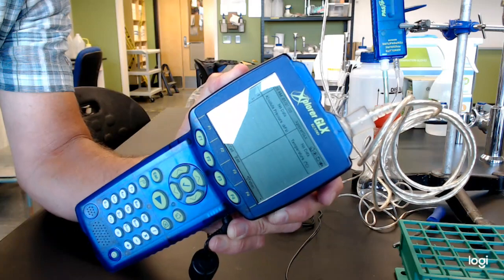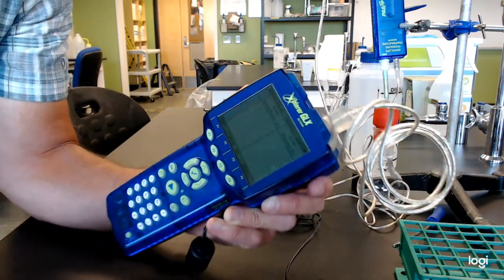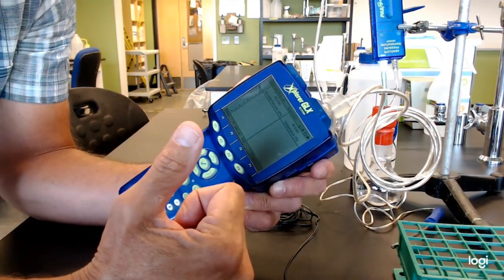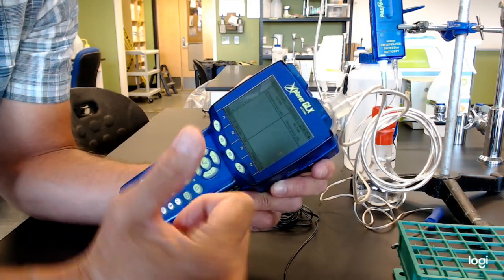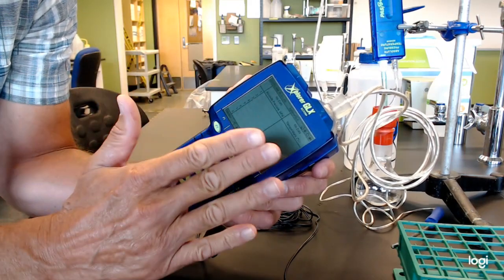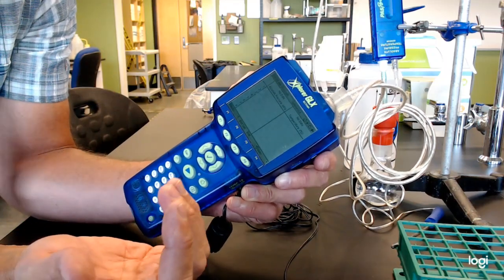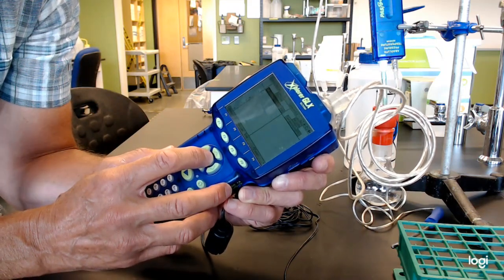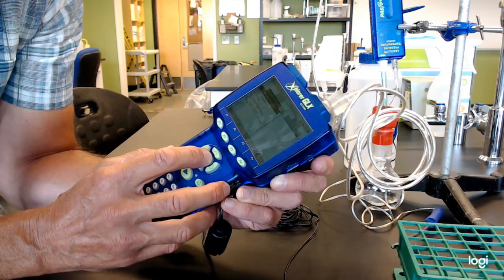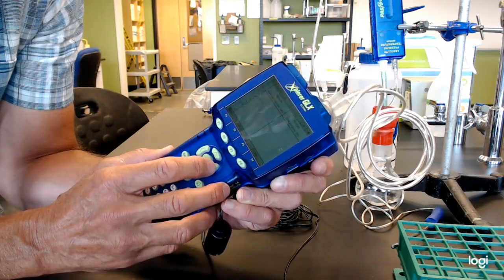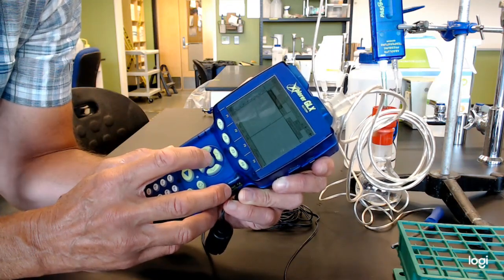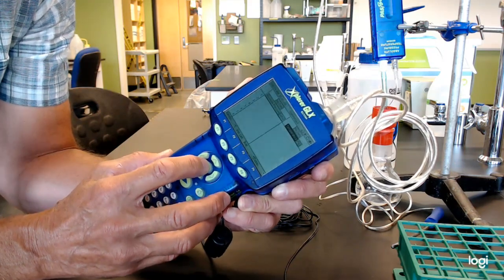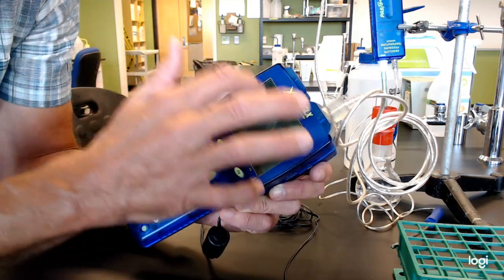So what I would like to do is actually log temperature and pressure, right? So don't despair, because we know we probably are seeing the probes, but there's nothing registering here. Click once. Click again. And it says absolute pressure. That would be great. Go to the right. Click once to get up there, and then you can start arrowing around across the top. And then you can select, oh, I'll read temperature. That's good. So I'm going to read pressure and temperature. And if you want, you can change the units.